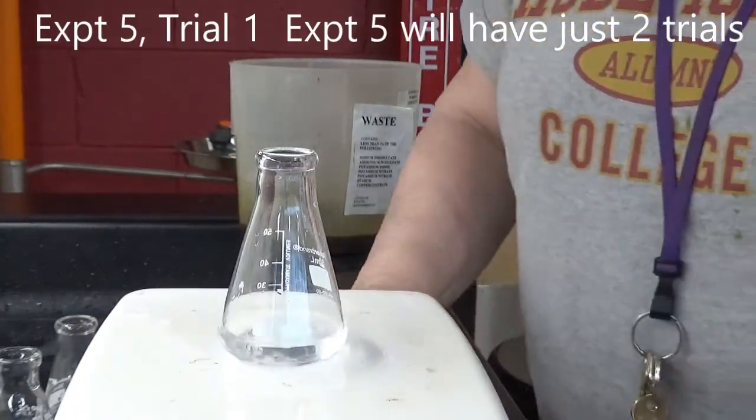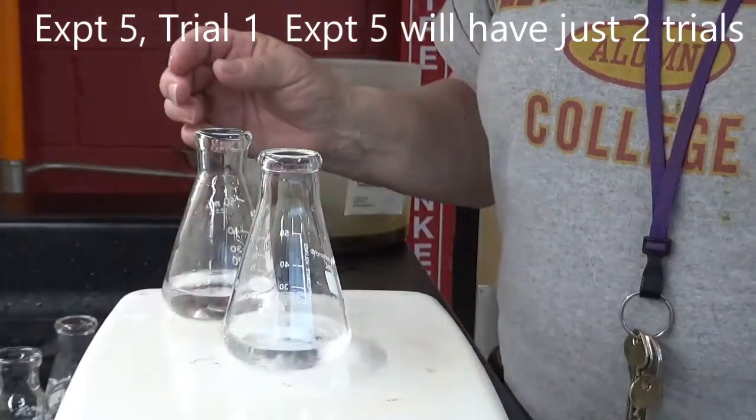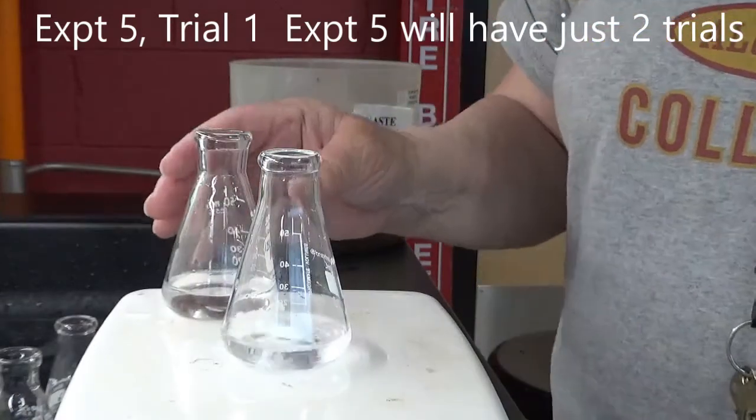This is experiment number 5, solution A and solution B. Now, this is not necessarily as long as the last one, so look carefully.